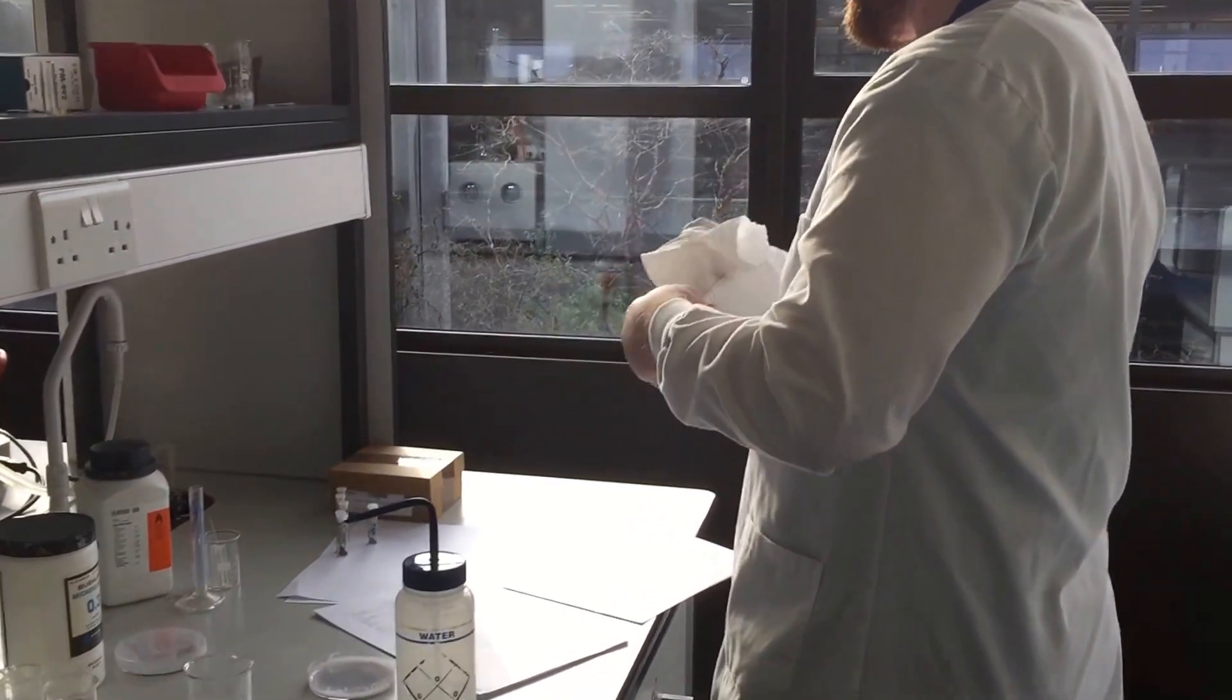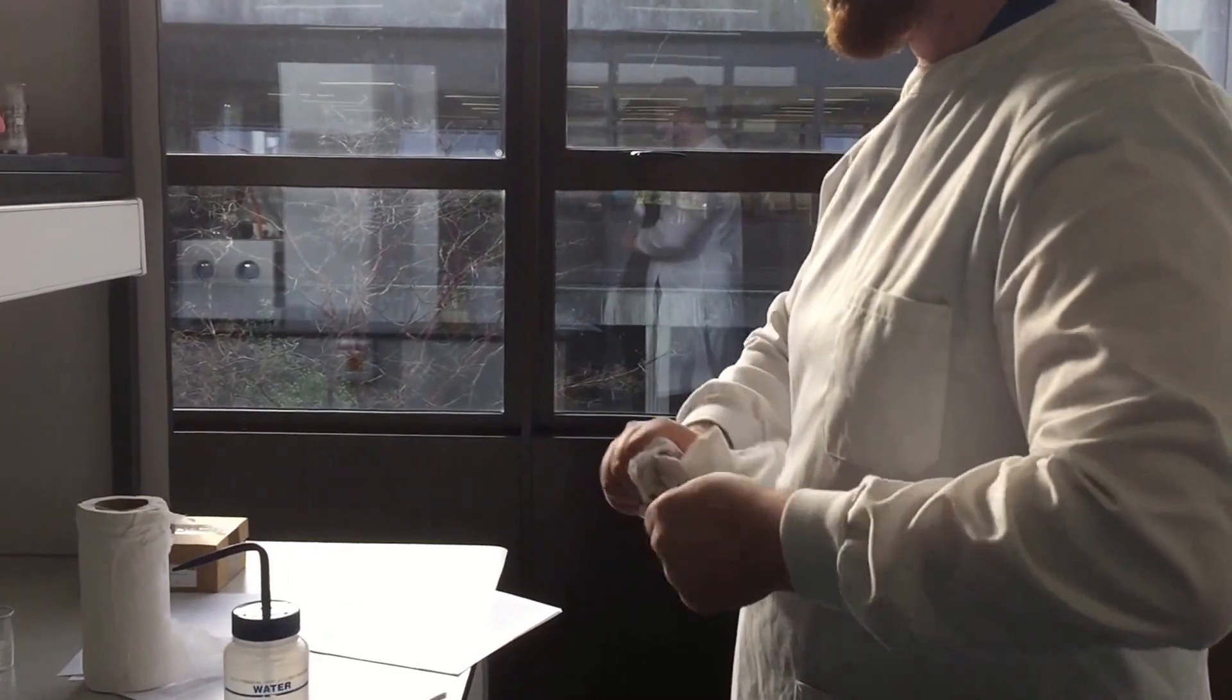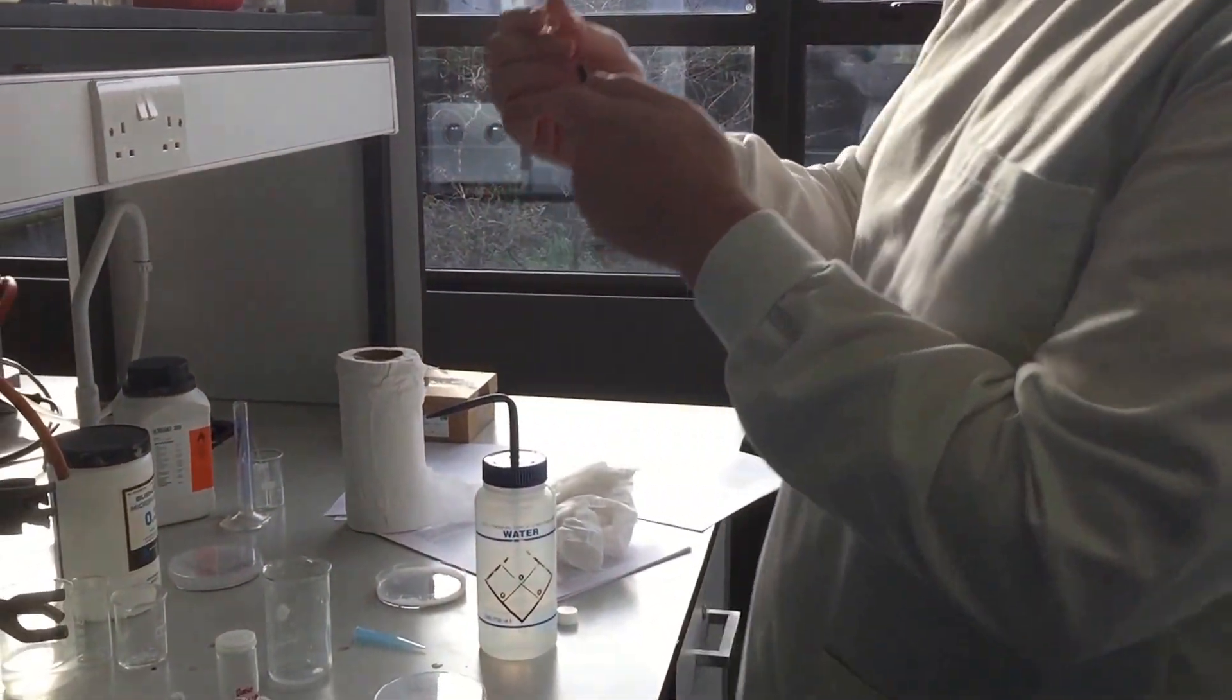You better pay attention to it. I expect you to do the other ones. Actually, I'm going to listen in. So you dry it out after you polish it. I'm assuming this looks clean, so put that on top.